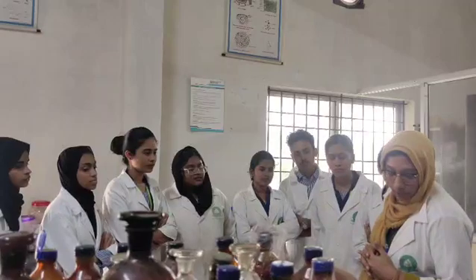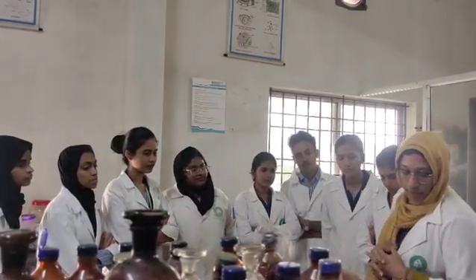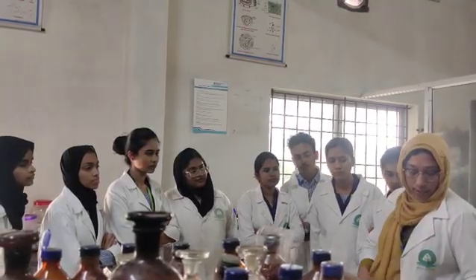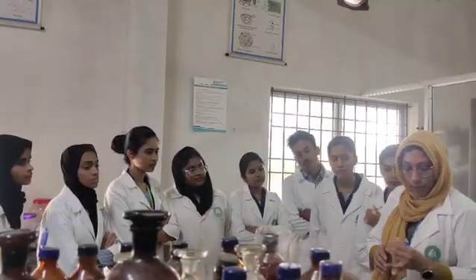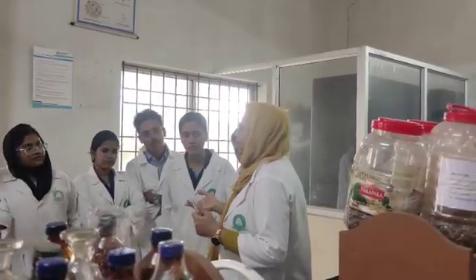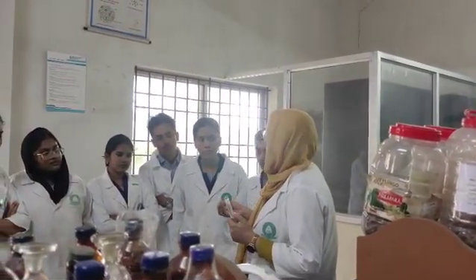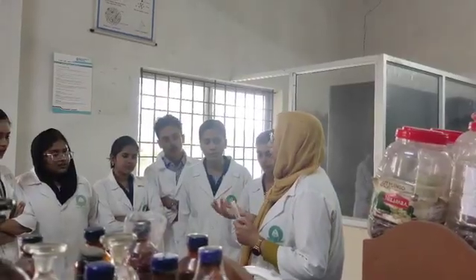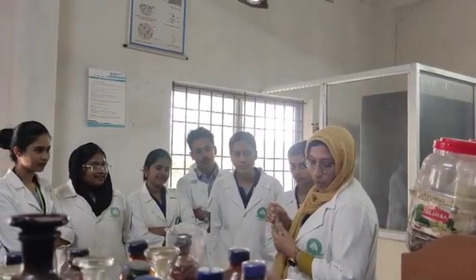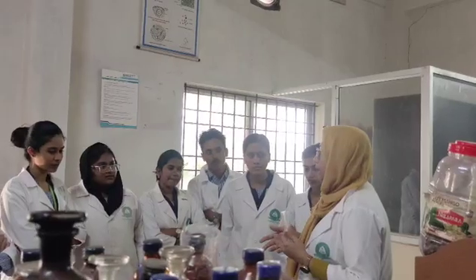The aim of this experiment is to perform the chemical tests for acacia. In the experiment, 0.5 gram of drug is mixed with water, and 0.5 gram of drug is mixed with 2 ml of ethanol. What will happen if we mix it with water? If a carbohydrate is mixed with water, will it be soluble or insoluble? It will be soluble. Then maybe it is acacia, so it is confirmed as a carbohydrate.